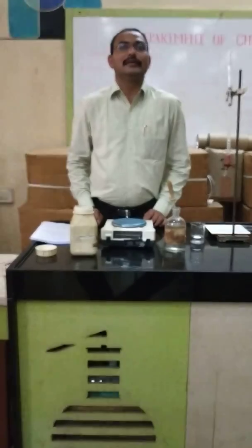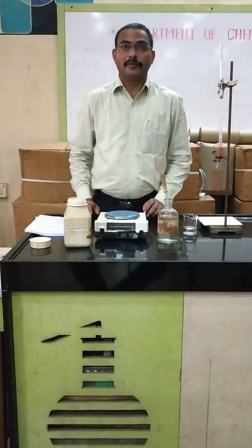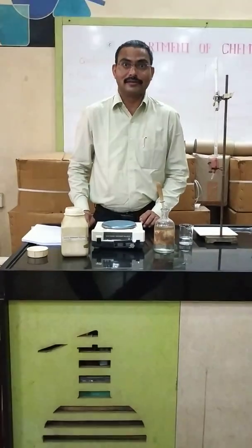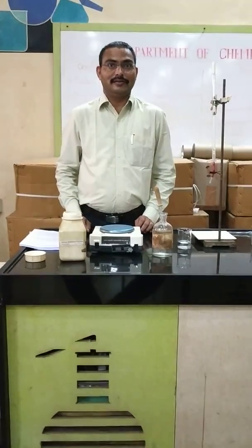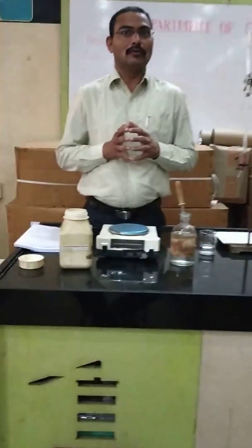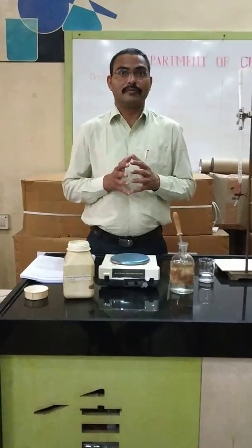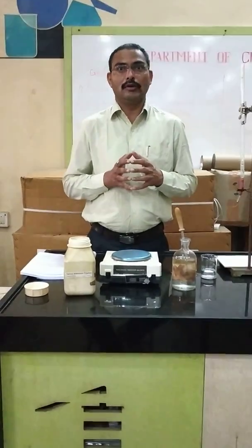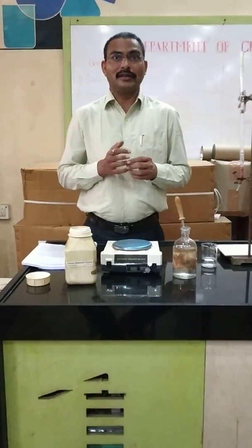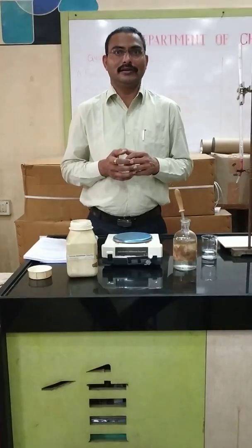Today we are going to start our important field of chemistry practicals, that is volumetric analysis. In 11th standard, we have already learned volumetric analysis. The measuring of volume is called volumetric analysis, that is titration. The method to perform volumetric analysis is called titration.